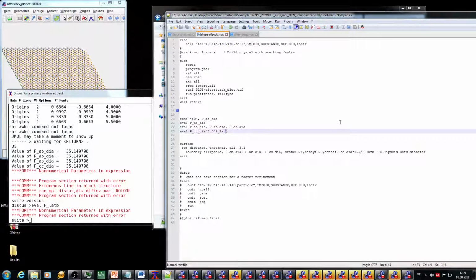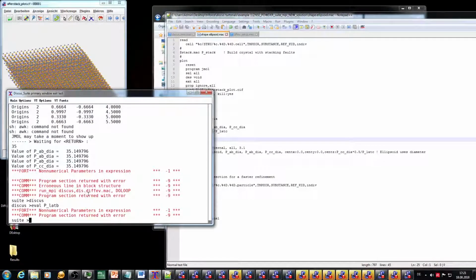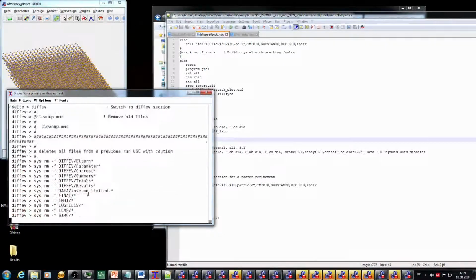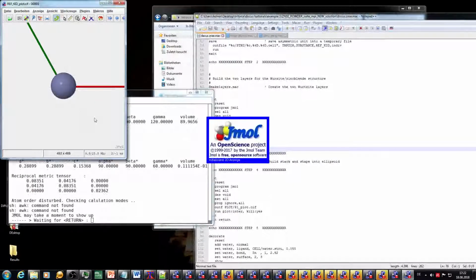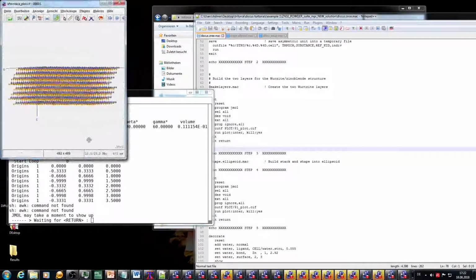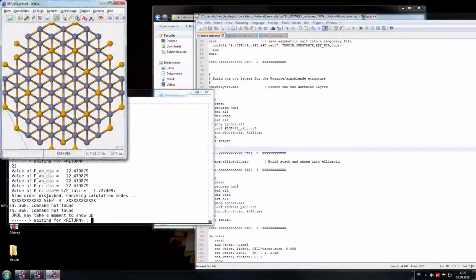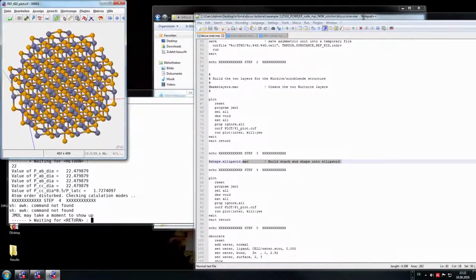So what we need to do here, we need to take an A or a C here, so that the calculation will work. It makes more sense to take actually the C to put it in the center of the crystal. So having changed just the parameter here, we should be fine. What we can try now is to run the macro again. So we are going to this first step, layer step, stacking step. And so now we reach step 4. Step 4 is after the ellipsoid mac, and now we have created here a sphere.